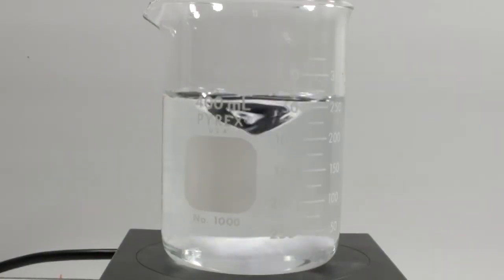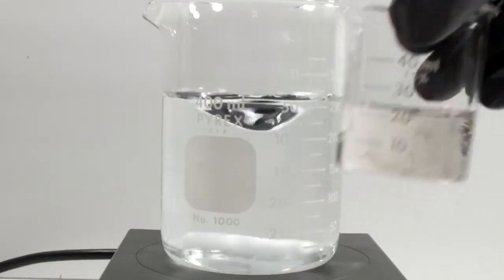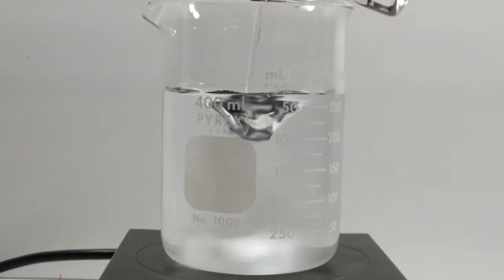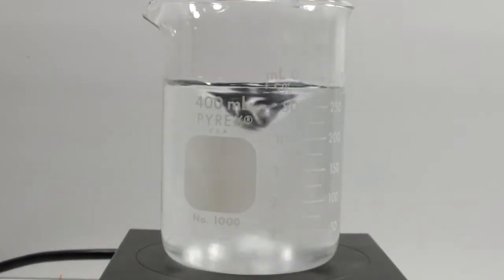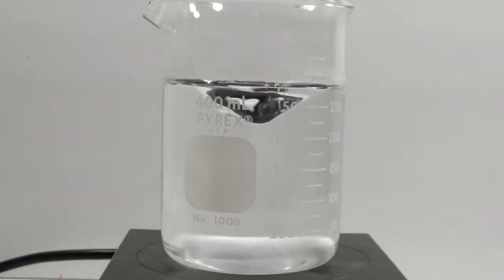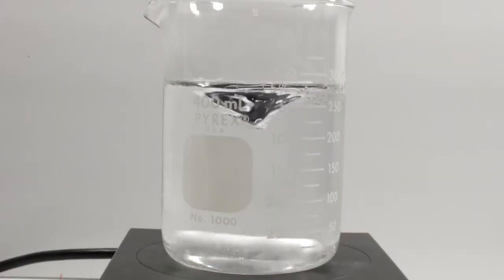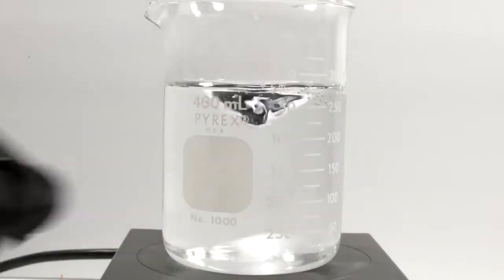We'll start by adding 25 milliliters of sulfuric acid to 250 milliliters of water. The sulfuric acid I'm using was extra from another reaction I did a while back, and it's starting to eat the cap on its temporary storage bottle. I hope dissolved cap won't inhibit this reaction at all. I'll leave it to cool for a little bit before proceeding. Okay, let's measure the temperature. Good enough.